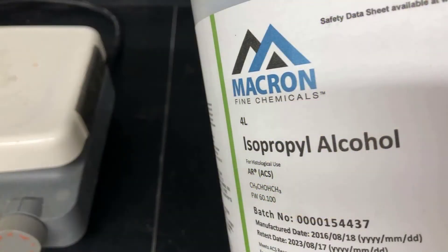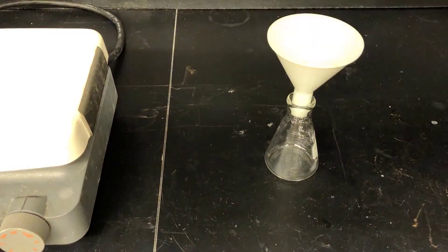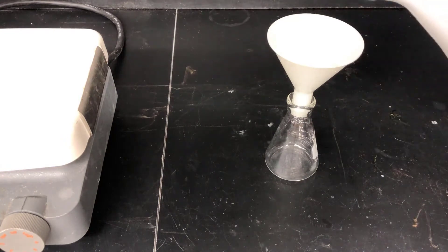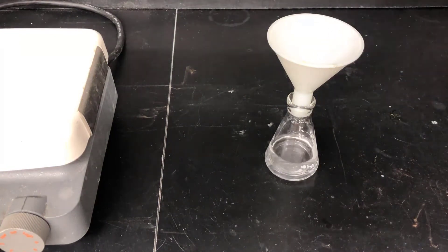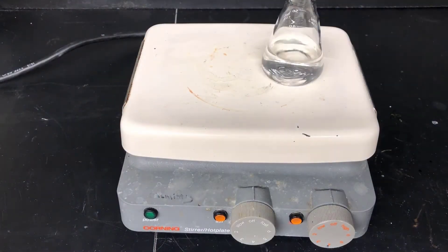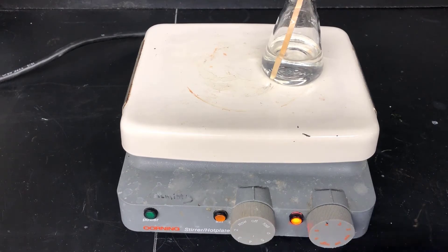I'll be using isopropyl alcohol to recrystallize the product today. This solvent is a good choice because it's a very good solvent when it's hot, but a poor solvent when it's cold. It also does a better job of dissolving the triphenylphosphine oxide product than the alkene product. These properties make it a great recrystallization solvent.